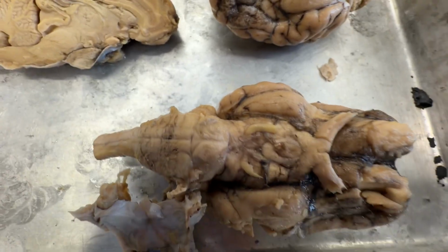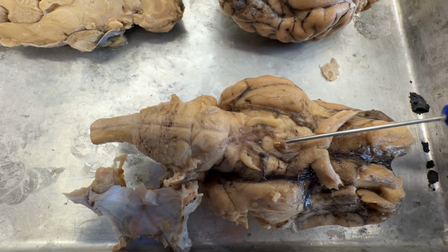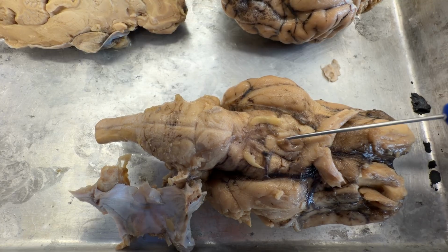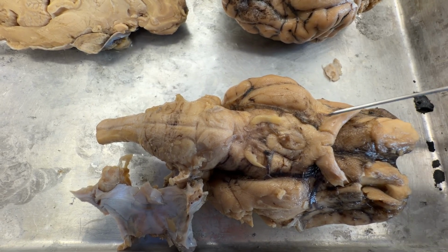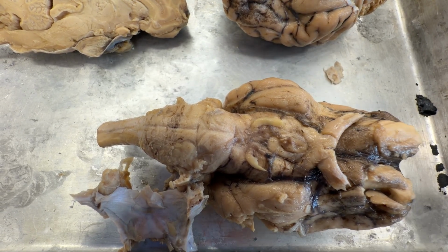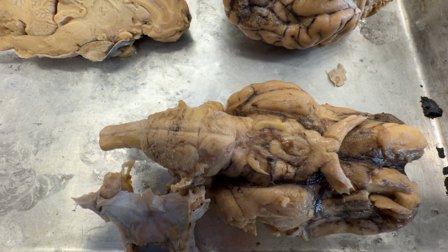All right, we have the ventral part of the brain here, and I've removed the pituitary gland so that you can actually see the infundibulum. It's a stalk that connects the brain down to the pituitary gland. Behind it and on either side are what are called the mammillary bodies. We see the optic chiasma better with our optic nerves and optic tract there, and we'll get back to the nerves a little bit later on.